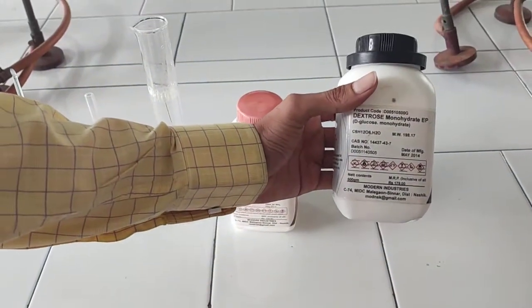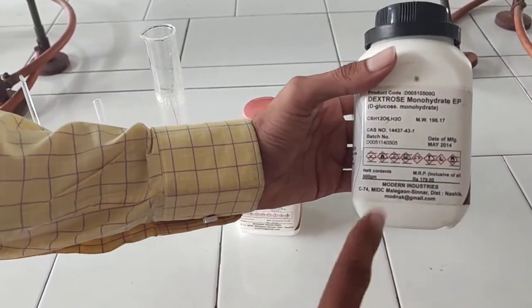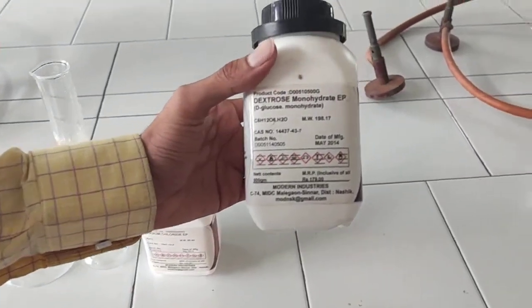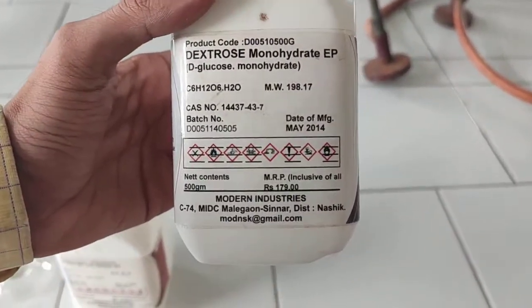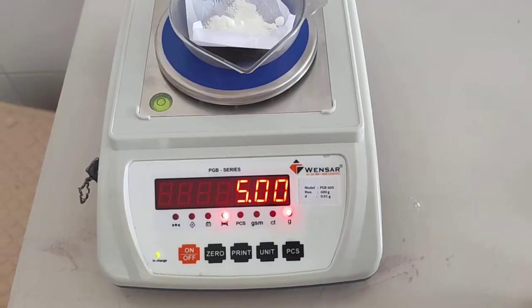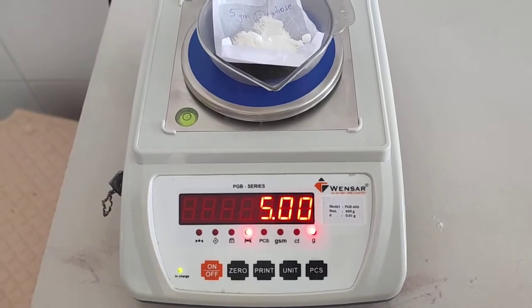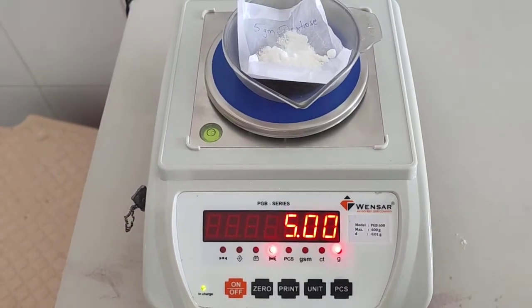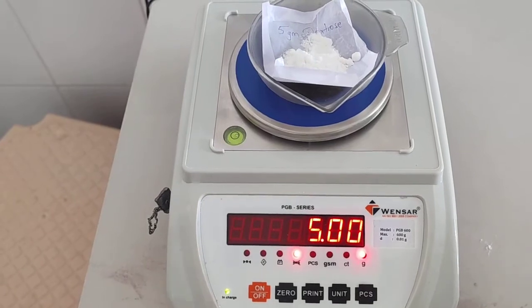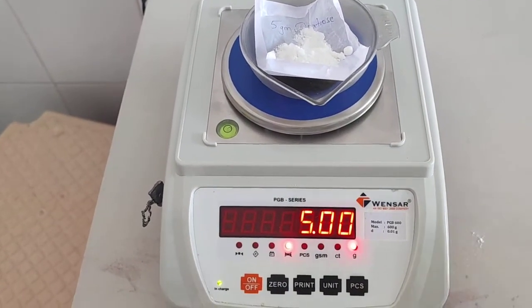This is dextrose monohydrate solution — it is highly water-soluble, so it is directly added into the water and shaken well until totally dissolved. It can be used directly as an intravenous preparation. The dextrose solute is 5 grams in weight, which makes it isotonic with IV fluid.